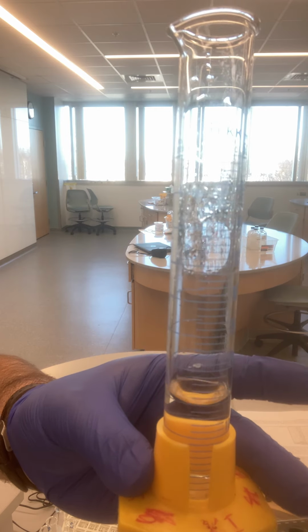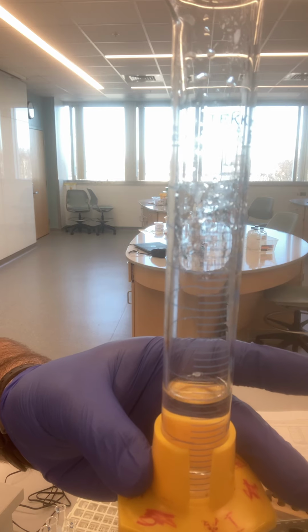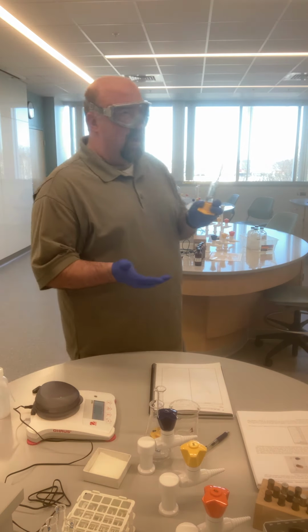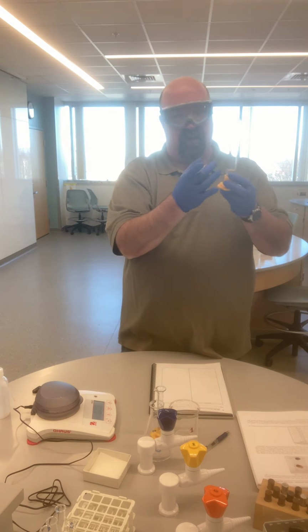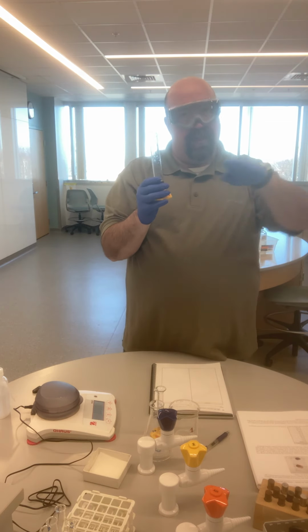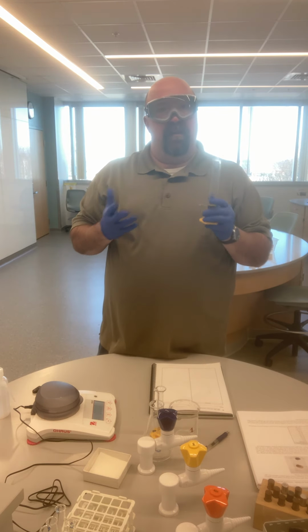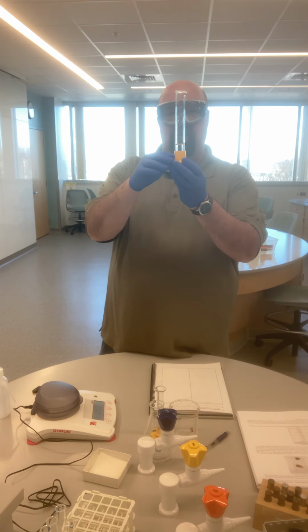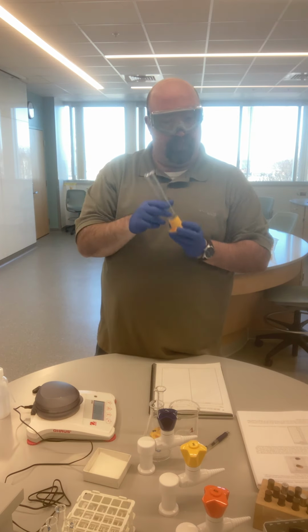And so we can see that graduated cylinder, or see the liquid in the graduated cylinder, and we see that curve. And so whenever we're measuring the volume in a graduated cylinder, again, we have that curve due to some of the properties of water that cause the water to climb up the sides of the cylinder a little bit. That curve is called the meniscus. And we always measure at the bottom of the meniscus. So that's just something to keep in mind with volume measurements using graduated cylinders, is that we measure at the bottom of that curve.